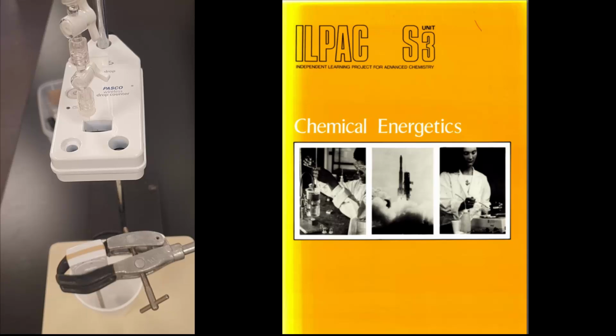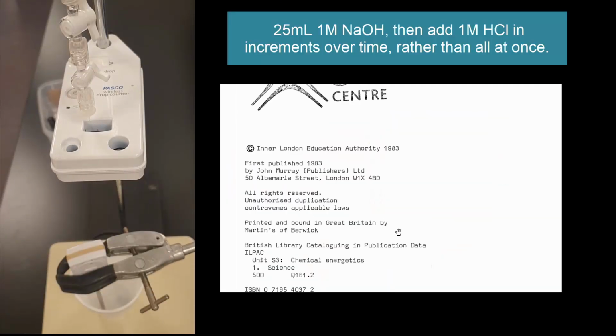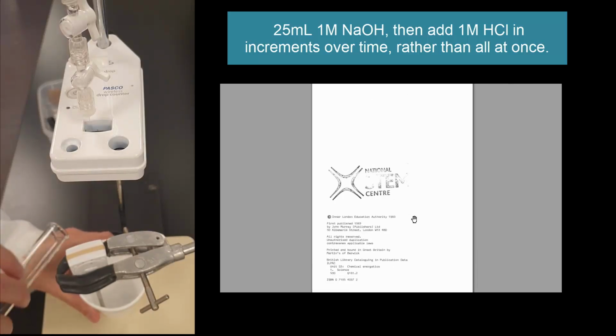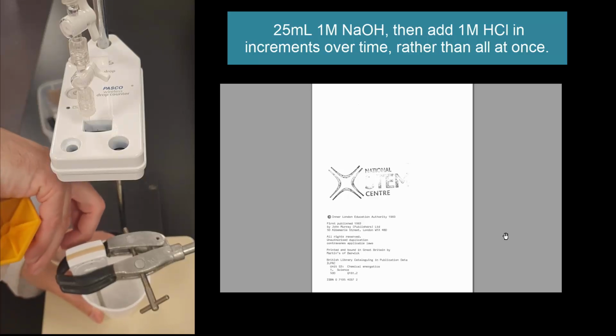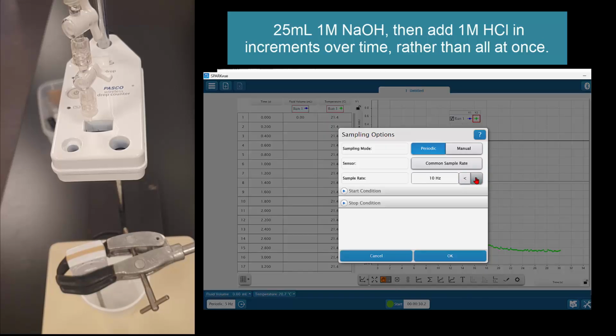Now I'm just quickly going to show you this experiment because it's popular among some teachers, and it's even in some IB exams. So it comes from about 40 years ago, and I think because our technology is a lot better now, we probably should do away with it, to be honest. What it is, basically, you just add volume of acid continually past the equivalence point and measure the temperature as you go. And then you basically have to draw two lines of best fit to try and work out where the highest temperature point is and the correct volume of acid.